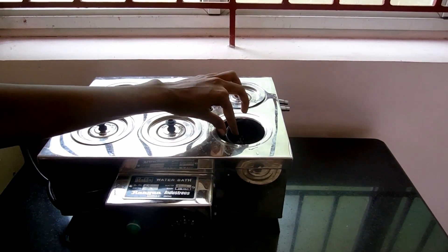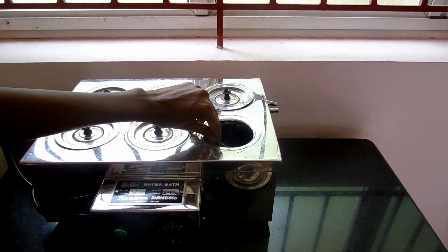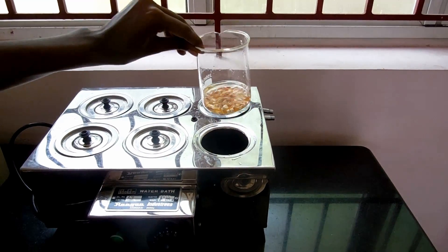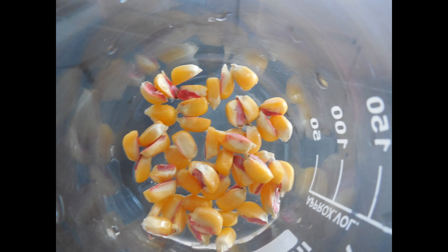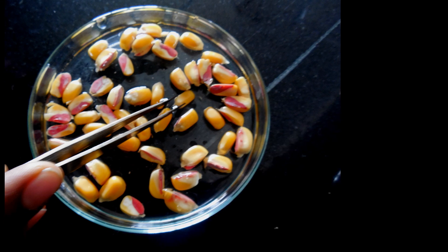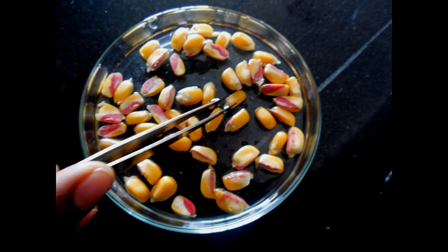After one hour, take the beaker from the water bath and drain the solution. Observe the staining pattern.